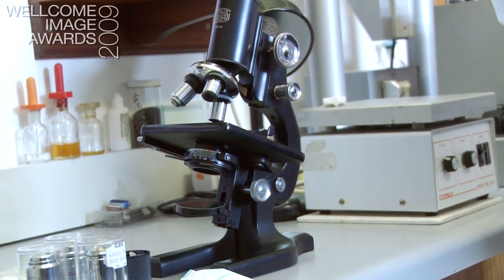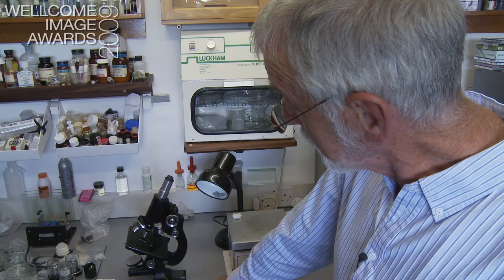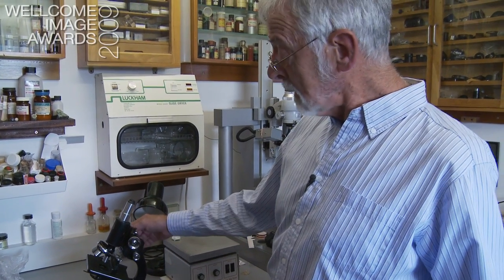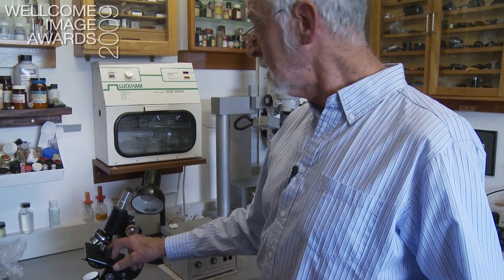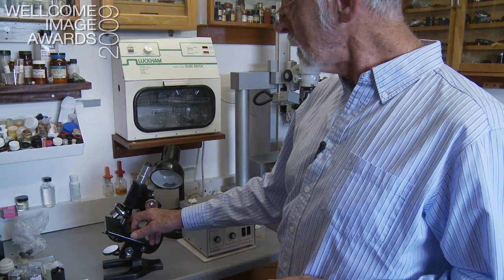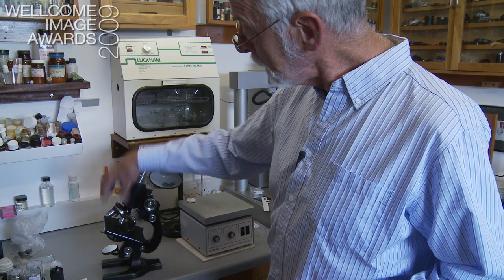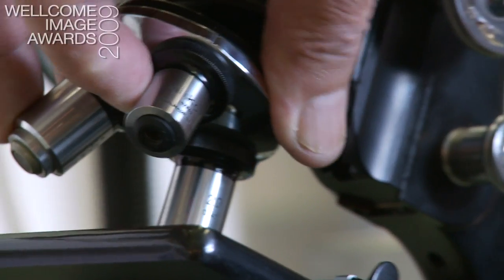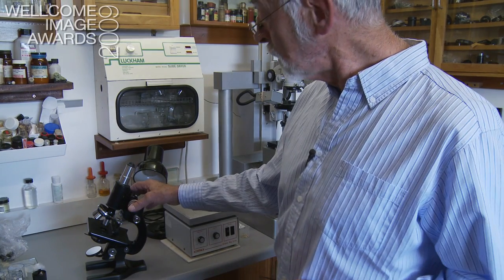This is an example of a fairly simple microscope — an advanced student's microscope, probably from the 1930s or 1940s. You can fairly easily see its components. These are the objective lenses. These are the things that put the detail into the image, and they also do some magnification. Usually on this turret or nose piece, we've got three, four, or five of these objectives of different magnification and with different resolving powers.